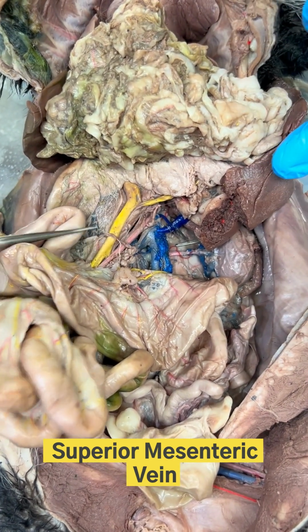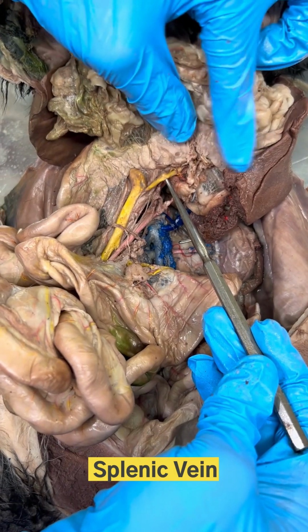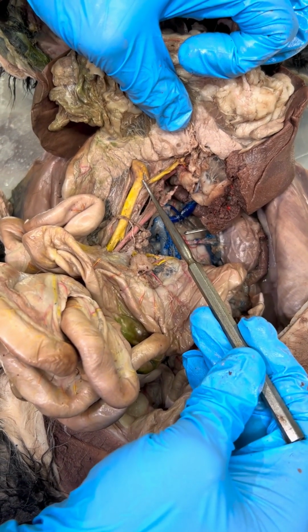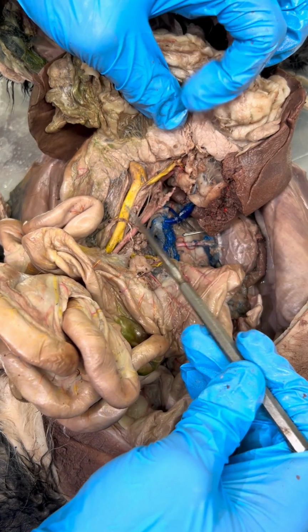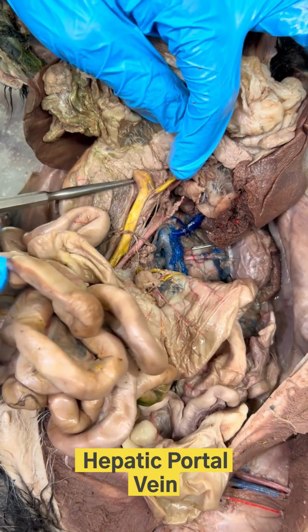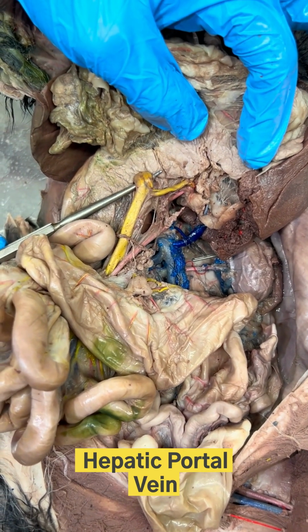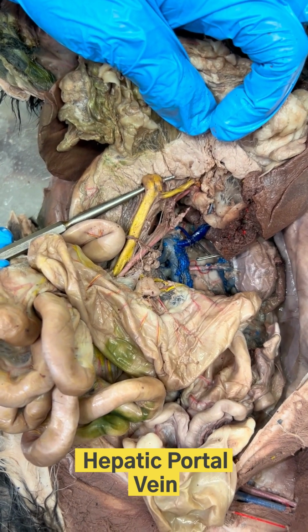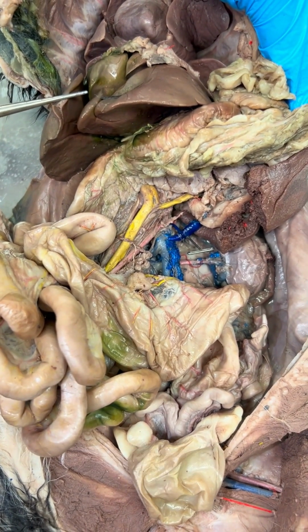Notice, here's the spleen right here, and so that makes this yellow vein coming over from that the splenic vein. Right here is where the splenic vein merges with the superior mesenteric vein to make this really large yellow vein I'm lifting now, and that's called the hepatic portal vein. That's the vein that brings blood from the digestive organs into the liver so it can be filtered to be sent around the full body.